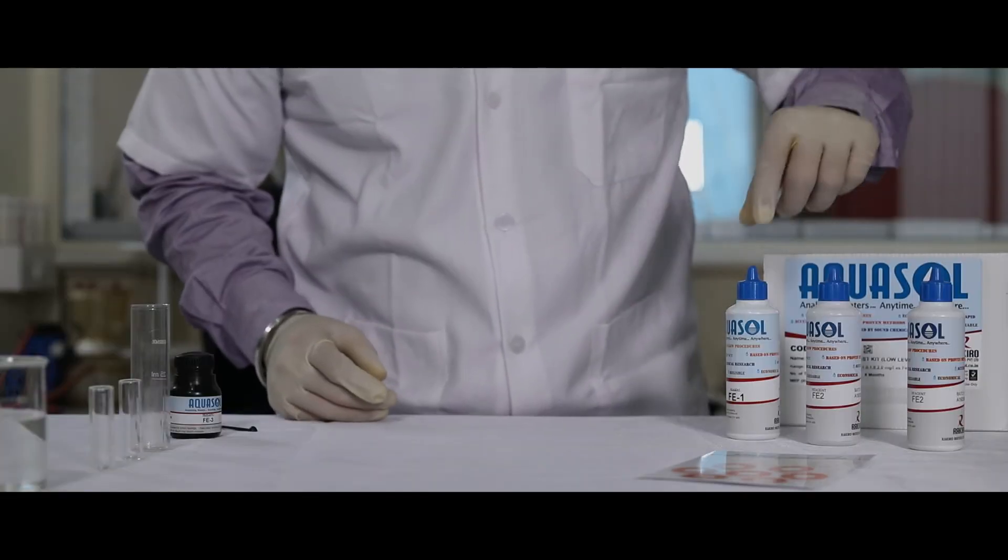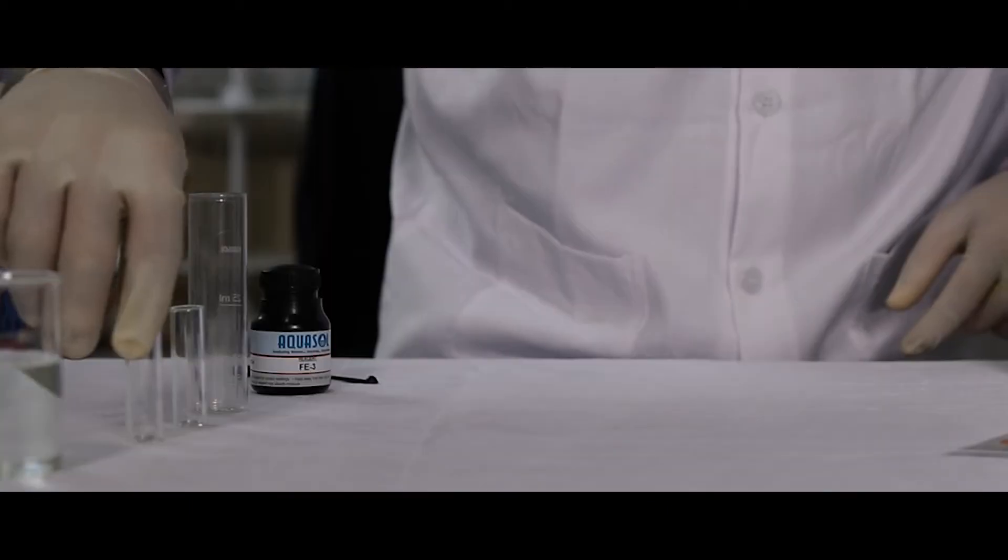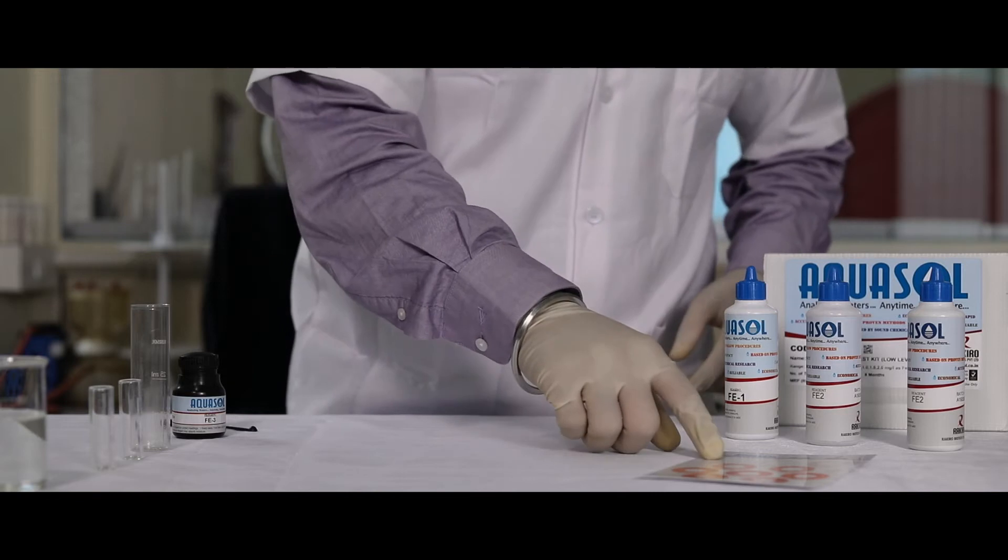AE303. This kit contains Fe1, Fe2 and Fe3 along with test jar, comparator tube and color shade chart.